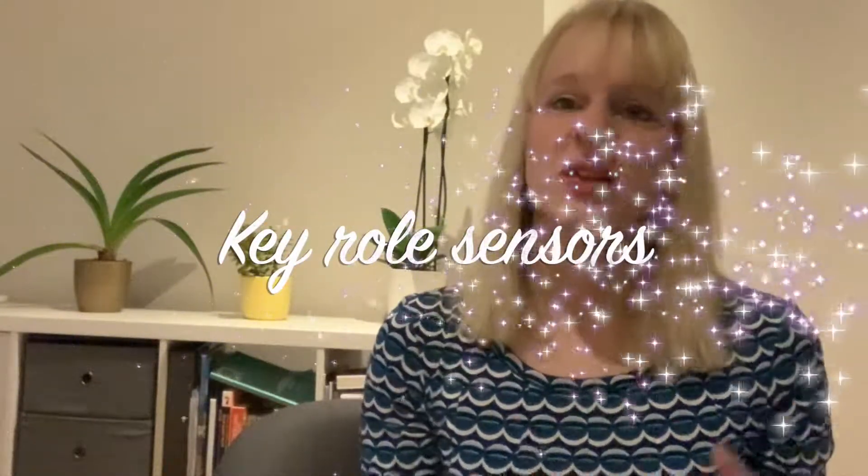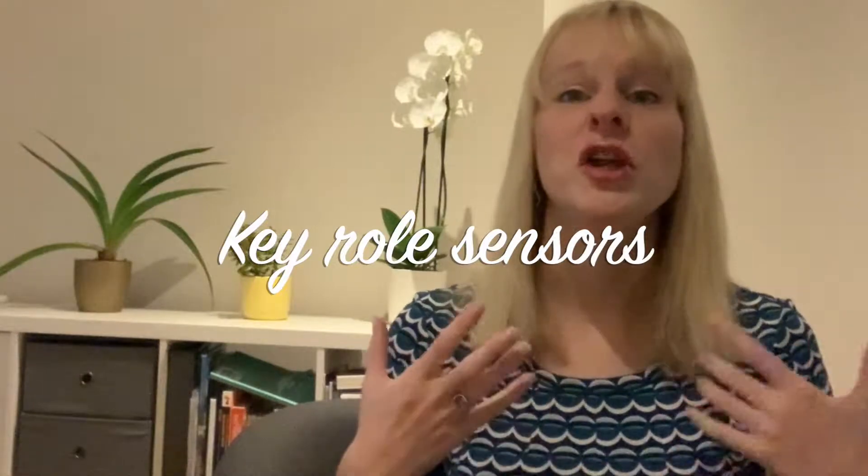We are living in the age of big data and that's not any different for engineers who have to adapt to this as well. Chemical engineers are responsible for the development and the manufacturing of important pharmaceutical products. In this video I'm going to show you how you would use sensors online in the reactor to monitor the quality of the developed pharmaceutical.